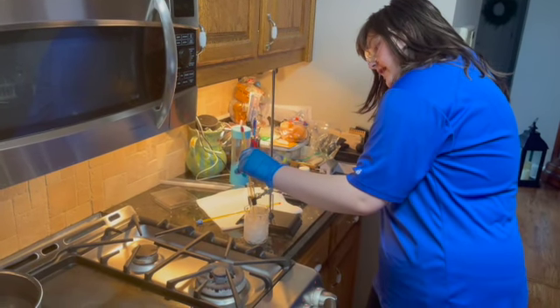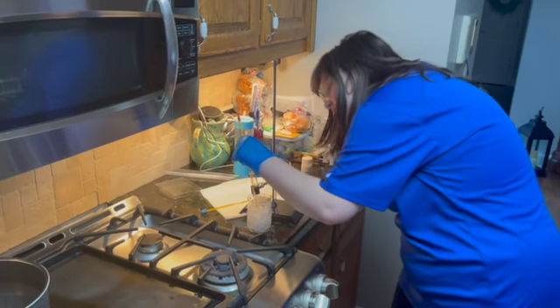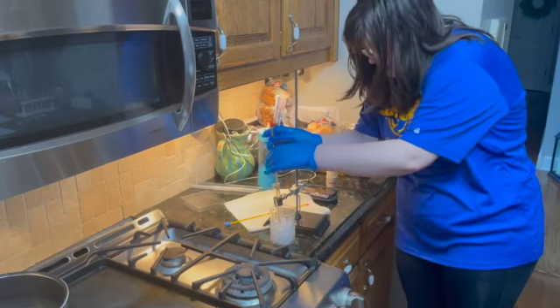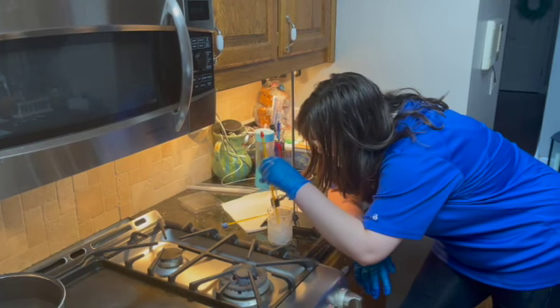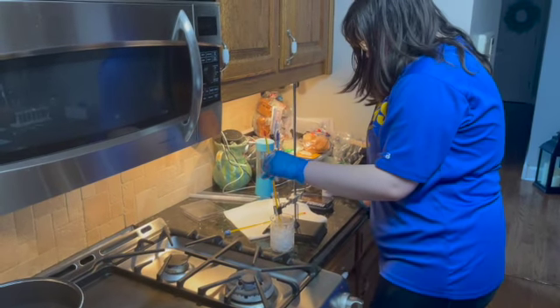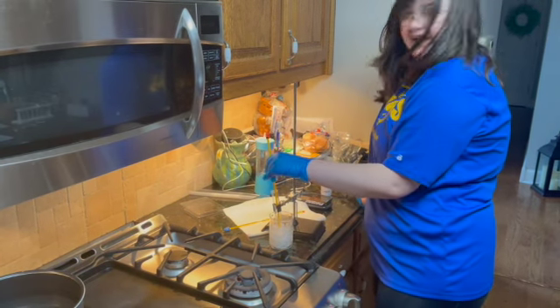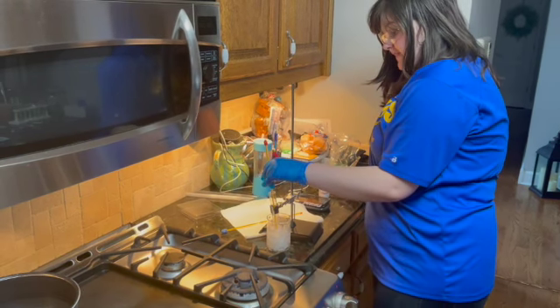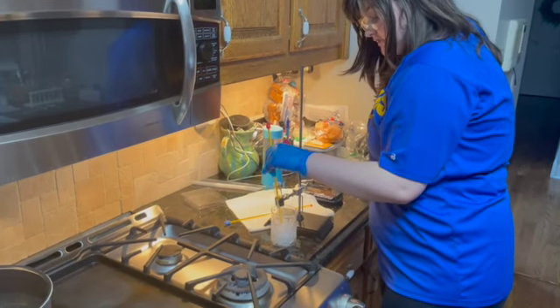So we are at our minute mark, and the temperature for this solution is now 39 degrees Celsius. And just looking at it, I can tell that some of it has already hardened at the bottom. It seems like it is going to be a white solid again, and from looking at it, it has formed some crystals.